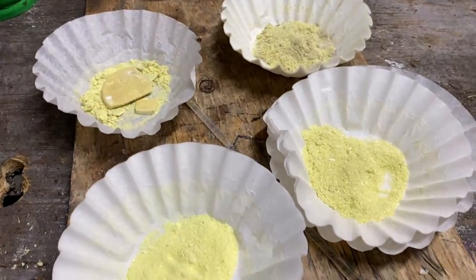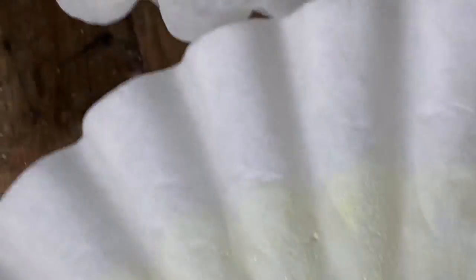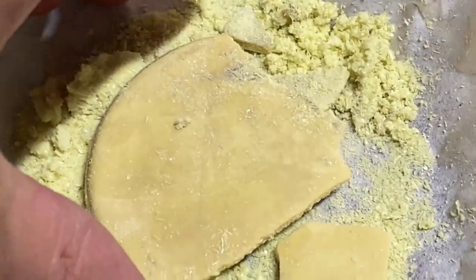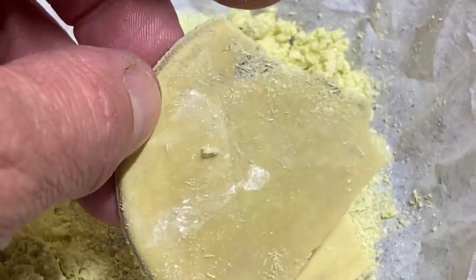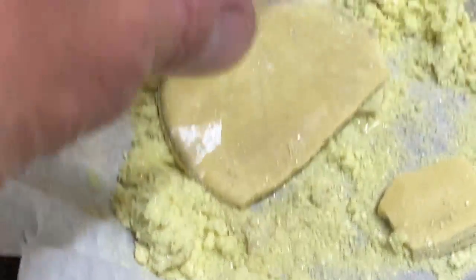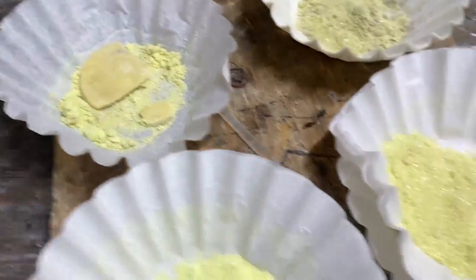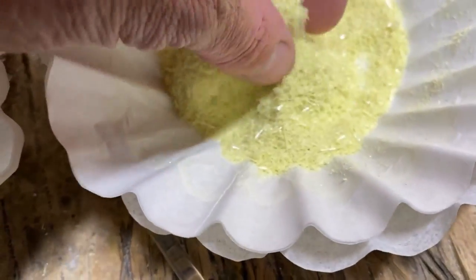So here's the four different grades we recovered. This is the top of the cleaner stuff, and this is the bottom — and it did indeed melt. That was a molten layer of sulfur in there; it kind of held all the dirt in it. I may redo this section. This is the top of that dirtier stuff — a little bit dirtier, much bigger needles. And this is the bottom.